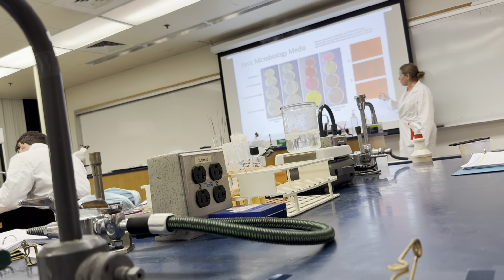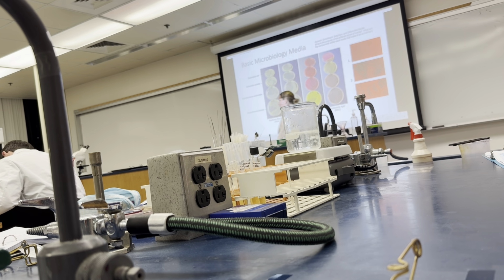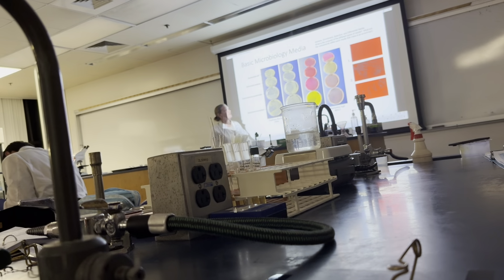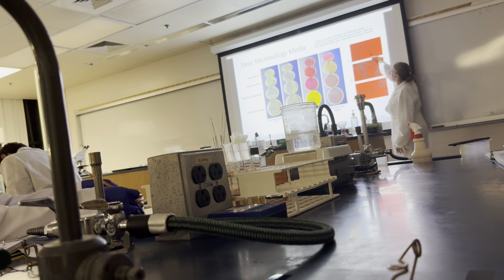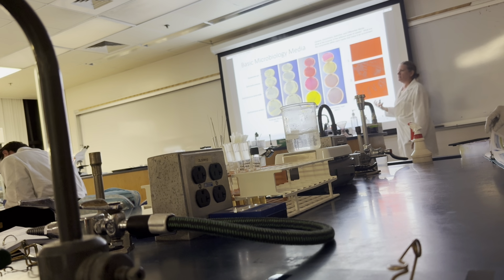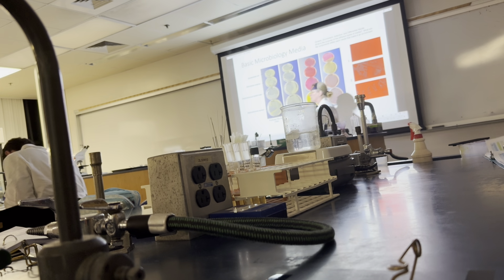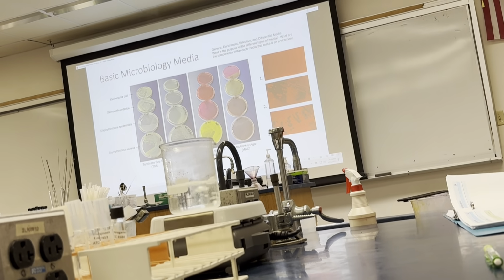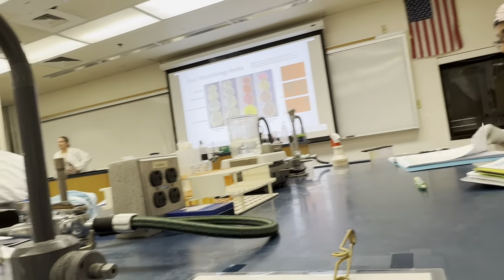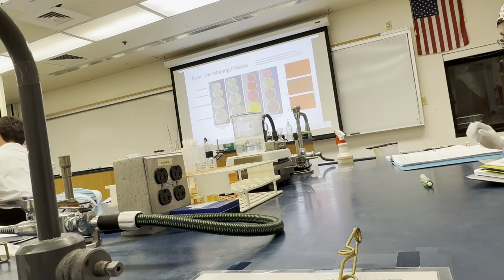As compared to this one, as you approach the individual colonies, you notice there's no haloing effect. And I know it's hard to see as it expands, and I turn on the lights for a moment. Maybe that doesn't help. No, it doesn't help. But when you look at it online, you'll see there's a haloing effect. It may not be as green in this picture, but you can see a fuzzy haloing effect around those colonies. That's the alpha. So one is what we're looking for if we were looking for alpha, and gamma will be number 3. They're in order, alpha, beta, and gamma, in this figure. Okay? All right.